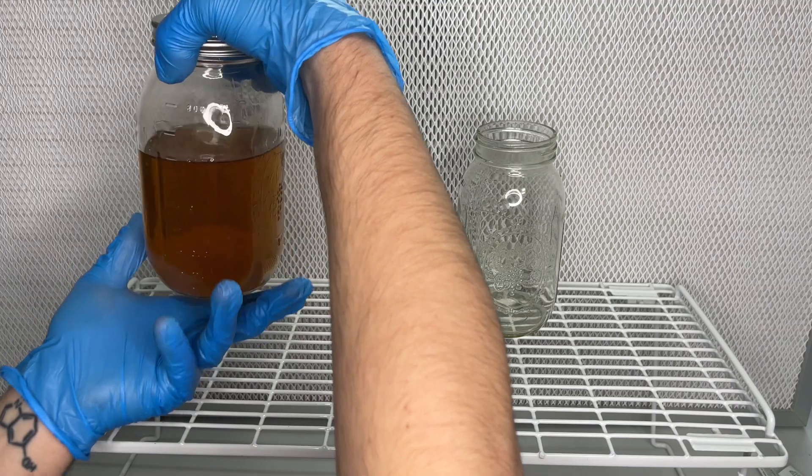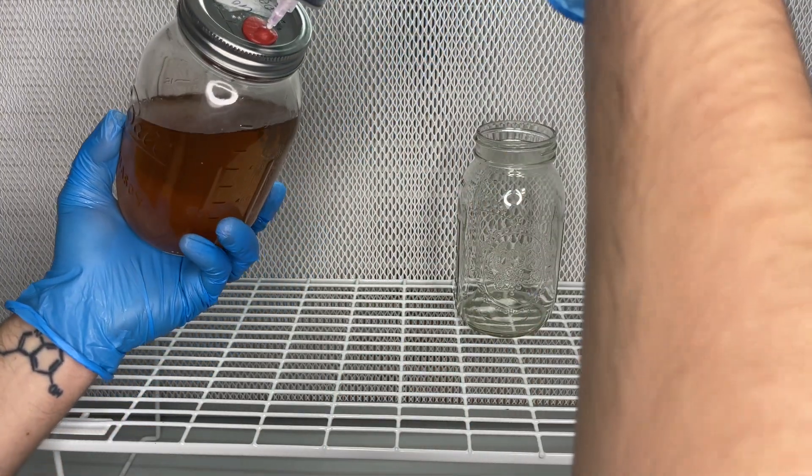The mycelium will stay at the bottom of the jar while I extract the extra liquid from the top.